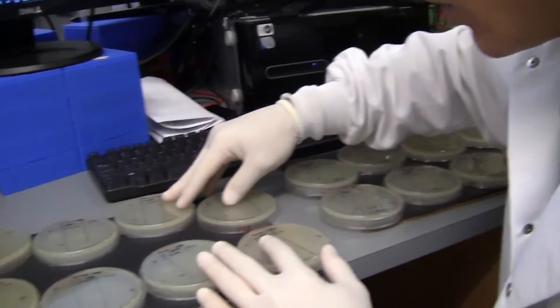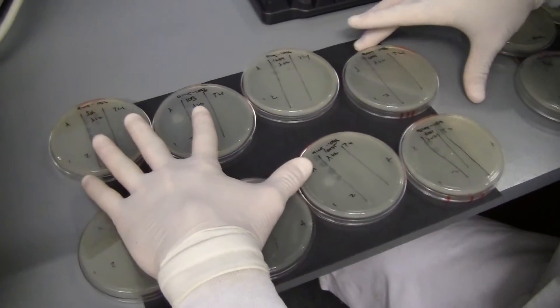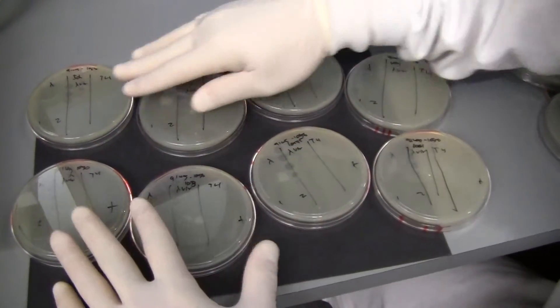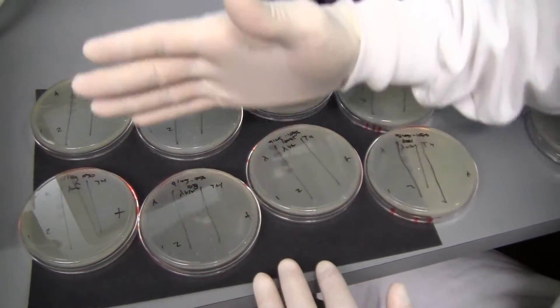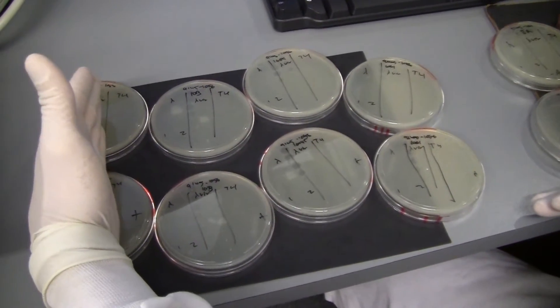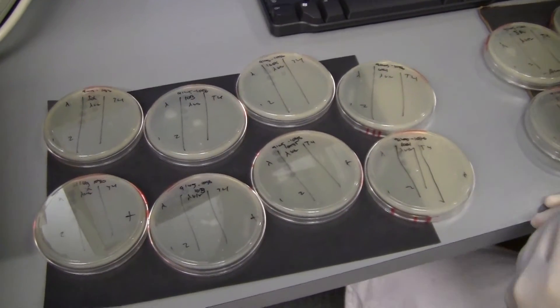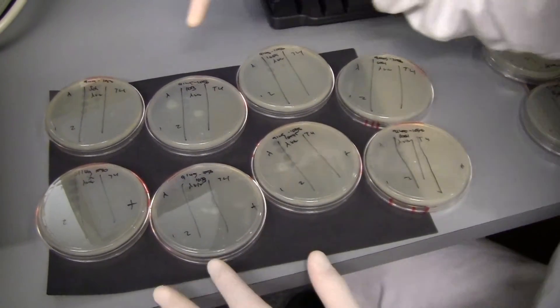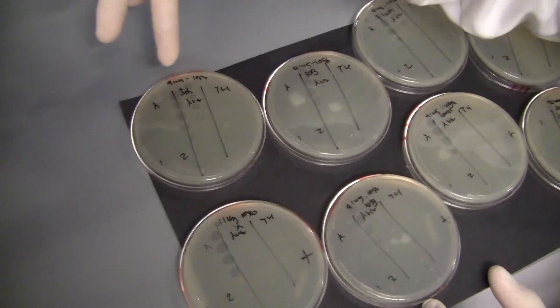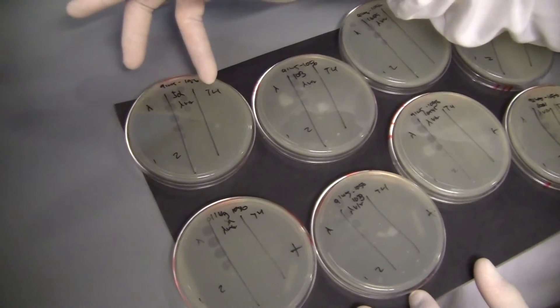Let's go back to the C1 plates, because this portion of the experiment worked a little bit better. We have eight plates: the top row is uninduced, the bottom is induced. We have four different strains — DH5 alpha, DH10b, MG1655, and MC1061. These are common lab strains. On each plate we have four spots: lambda clone 1, lambda clone 2, lambda vir, and T4.